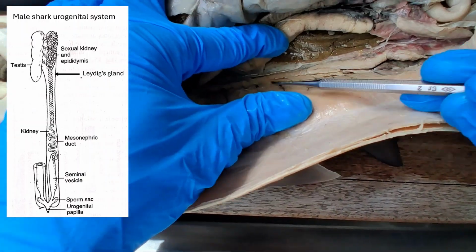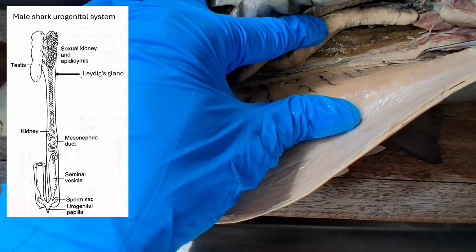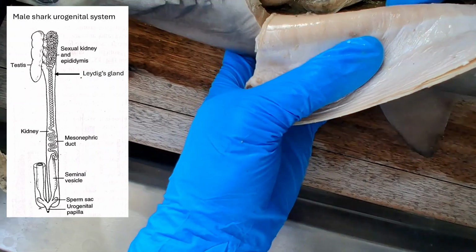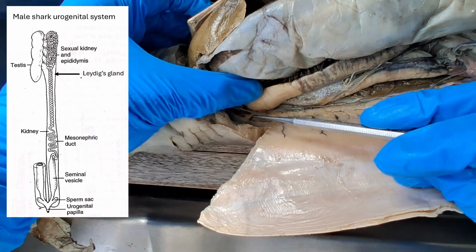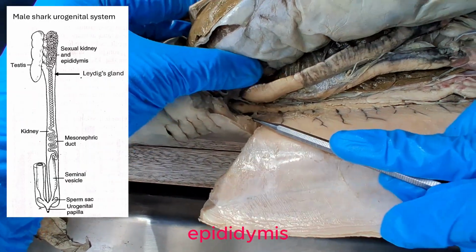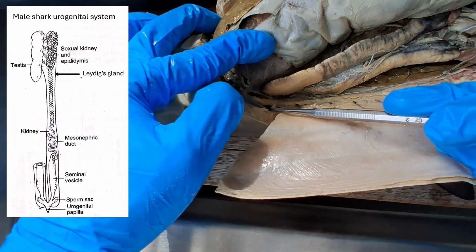Whereas this white anterior portion is the sexual kidney, because it doesn't function in excretion anymore, but rather reproduction. Okay, so the anteriormost end has been modified into an epididymis. So this anterior portion of the opisthonephros is the epididymis.